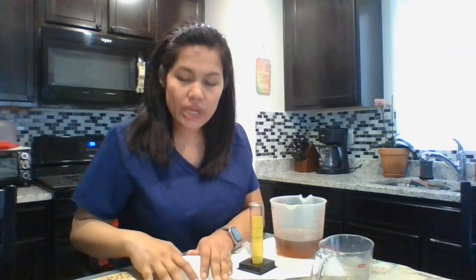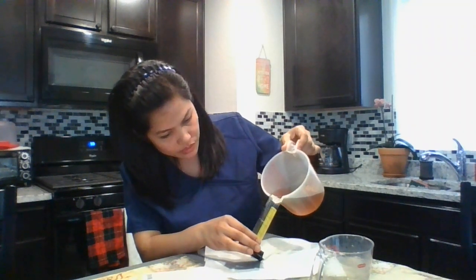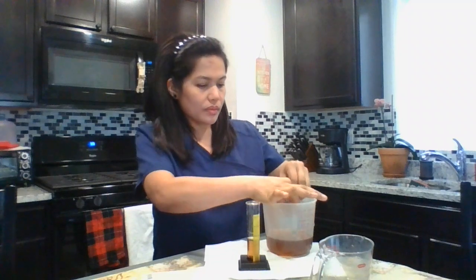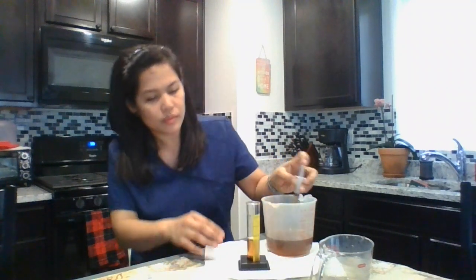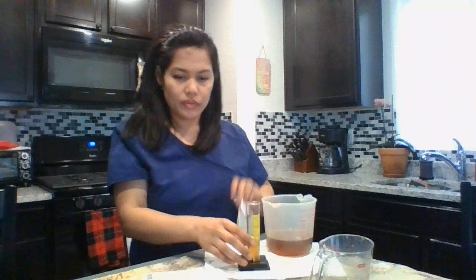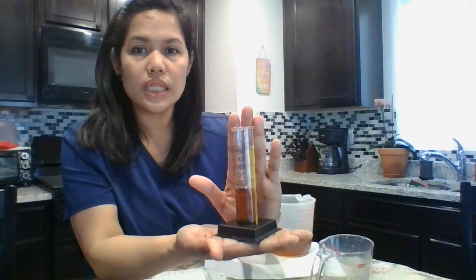Next is 26 times 5 equals 130 milliliters, so I'm going to measure 26 ml.